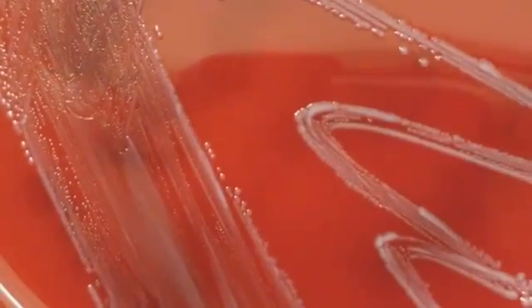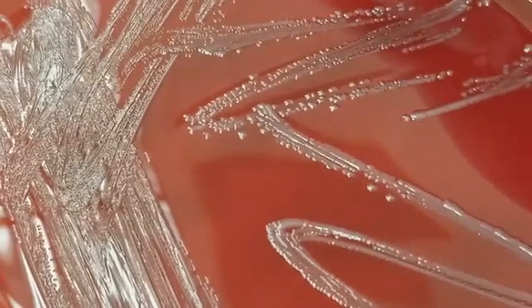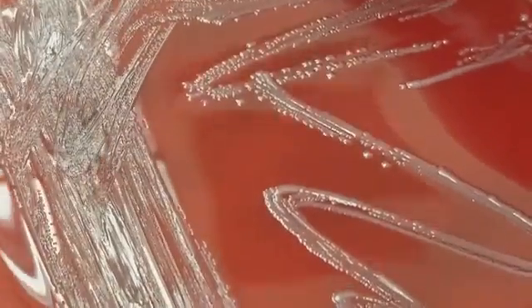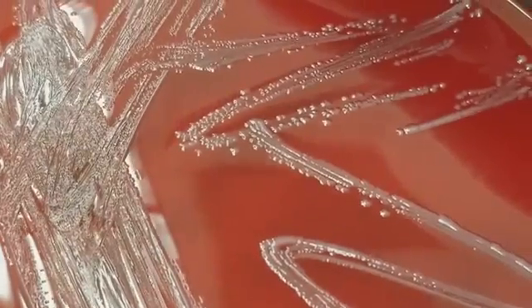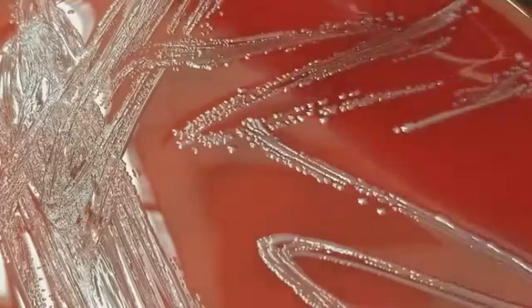Okay, notice that this is not the streaking of a urine culture again, because I ended up getting pure cultures from the actual specimen. The tech that made these for me was so gracious to do this, but I wasn't asking for pure cultures. I wanted to see what it looked like if the pathogen was just inoculated on there with any other microflora that might be there. But I am so thankful that they did this for me.